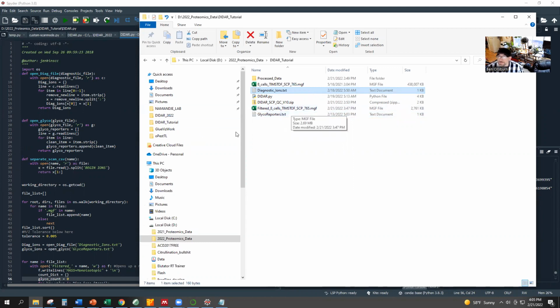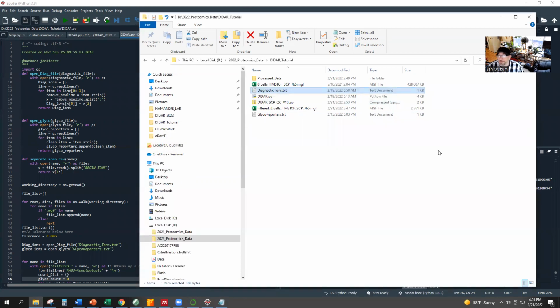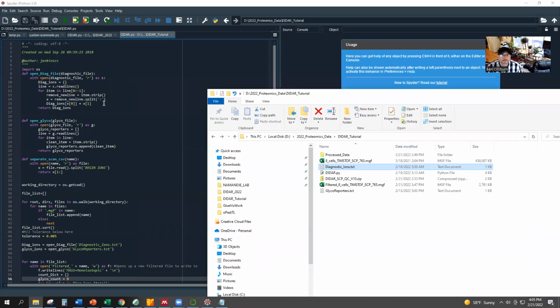But the diagnostic ions text, when you open that, it's really simple. It's just got the exact masses of the TMT reporter ions that were used in this study, and you can just copy those from wherever you get exact masses for diagnostic or reporter ions. It's really tiny. So you can copy this anywhere. What we want to do is put this in the file where your MGFs are that were generated from your scope MS data, and open DIDAR.py in this instance of Anaconda, which I've done here, and you get this little script.